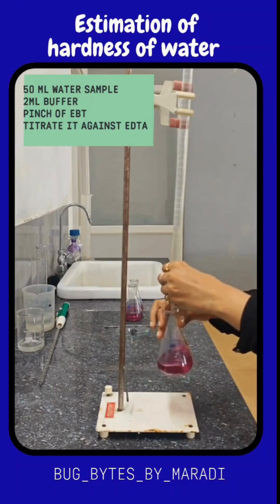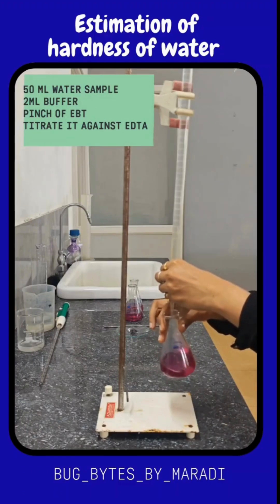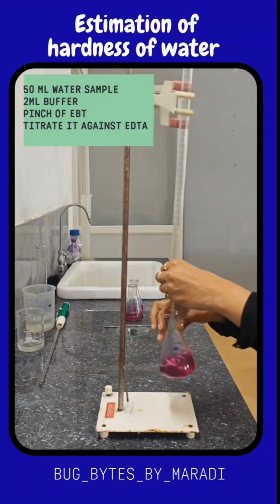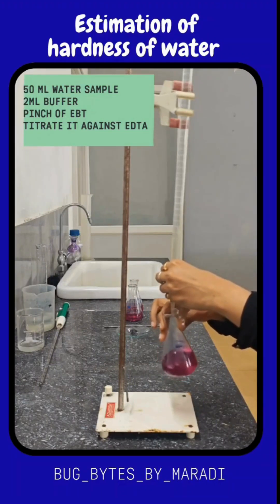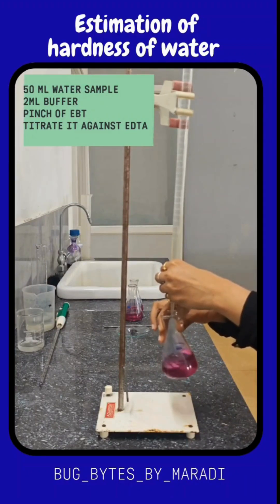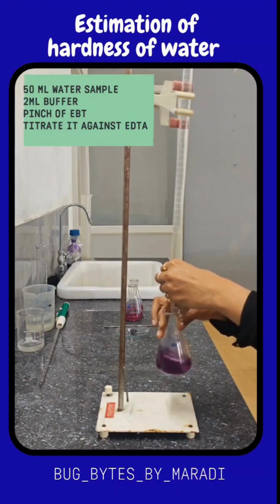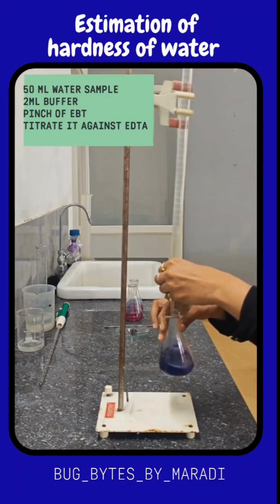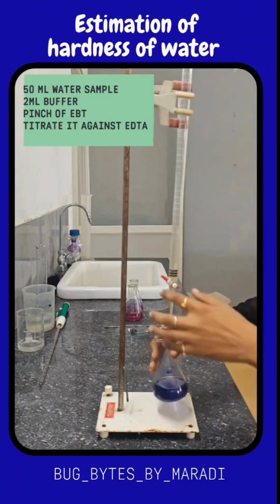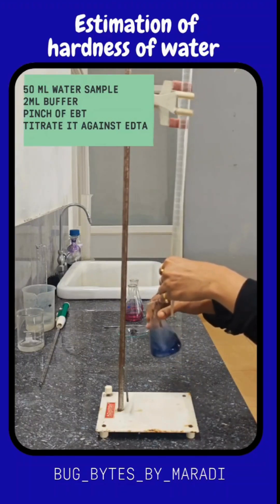As you add more EDTA, you will have free EBT in your sample solution. When all the calcium and magnesium is taken up by the EDTA, you are left with free EBT in the water sample. The free EBT will turn blue. So as EDTA is added, the color transitions from wine red to a purplish color, and then when all the calcium and magnesium is utilized by EDTA, the free EBT turns the sample solution blue.